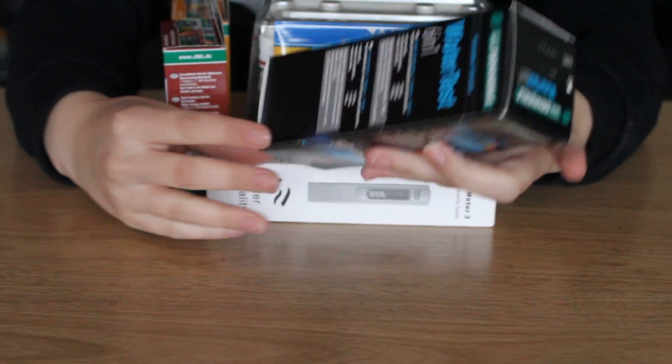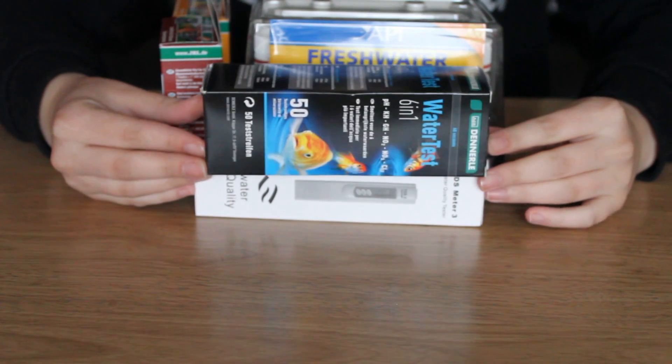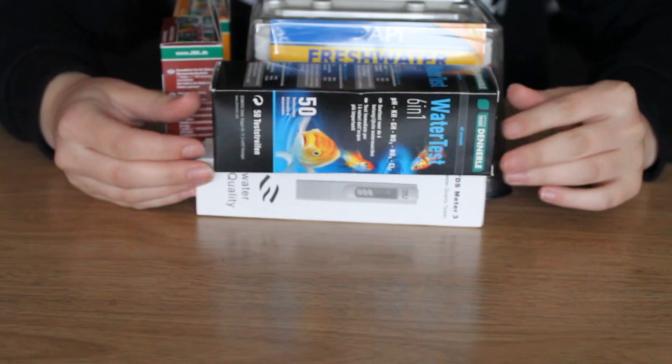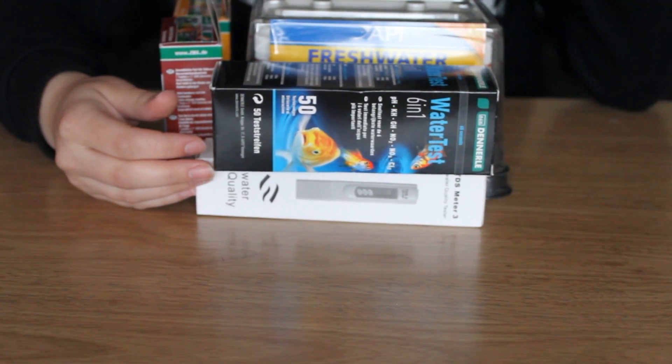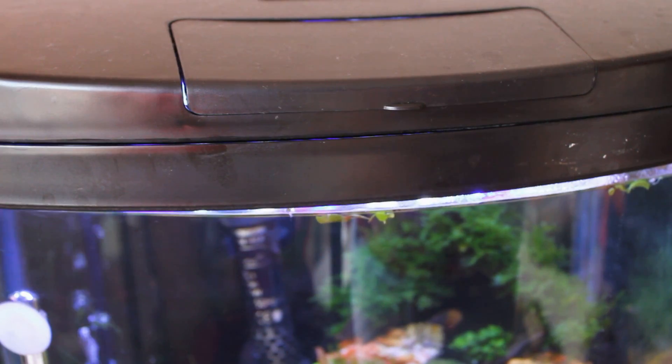We have the water test strips which were in my haul video. A lot of you guys said they're just indicators, they're not very specific. So we'll test the water with one of these and then compare the results with the master test kit.